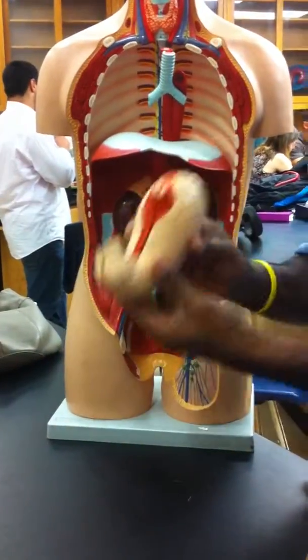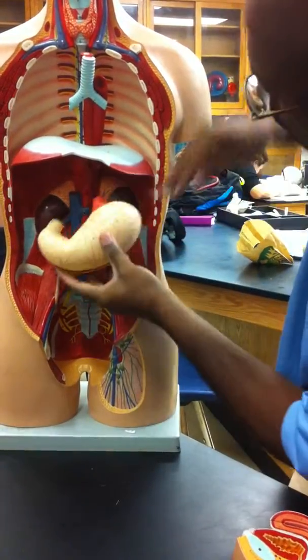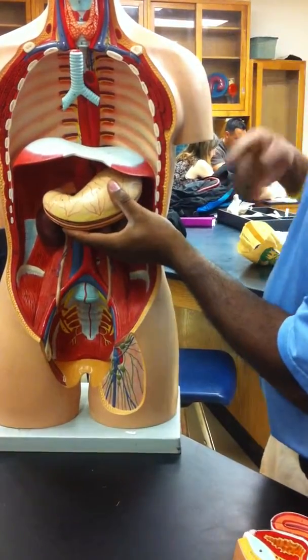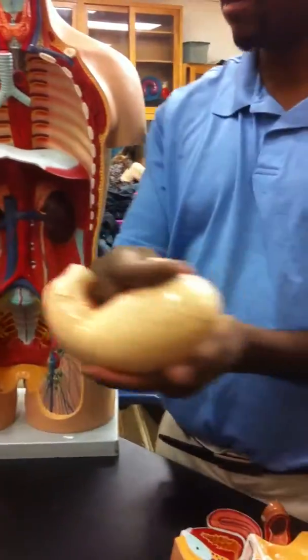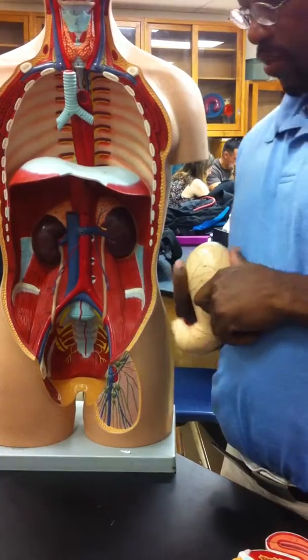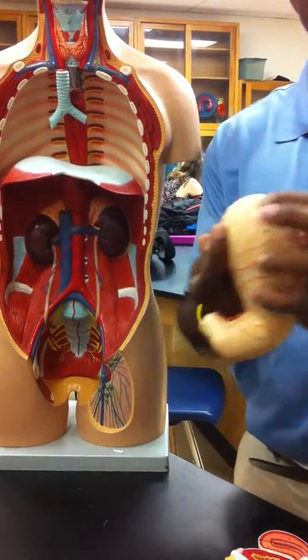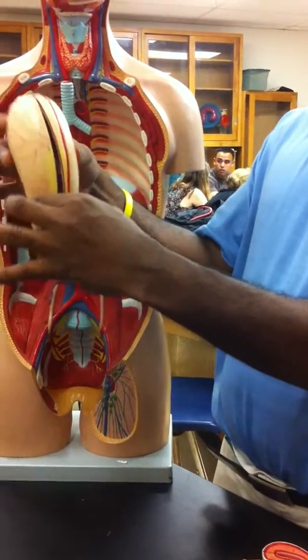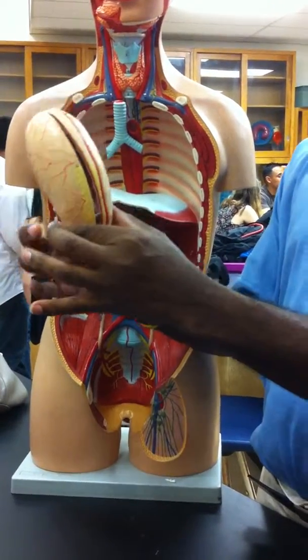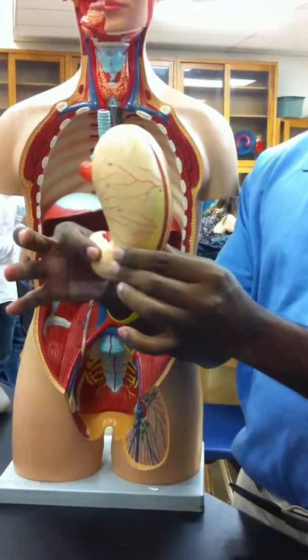The stomach has four parts. Remember it will be like this — your heart would be here, therefore this part is the cardiac region where my finger is. Notice there's a little bag on top — that's the fundus. And then the rest is the body. Then there's a little tail, the little end of the J, because this is a J-shaped organ. So then that is your pylori.